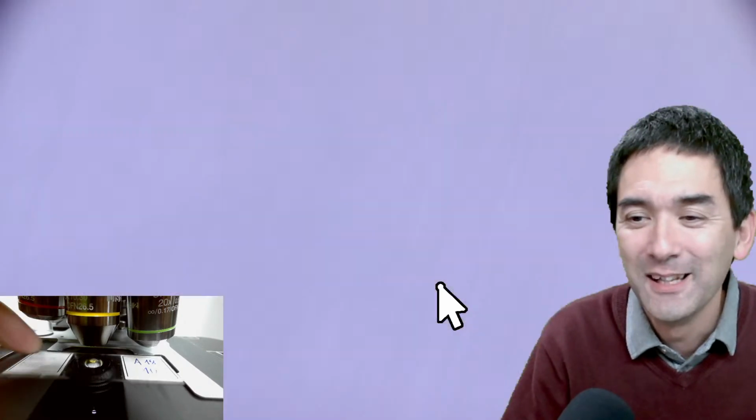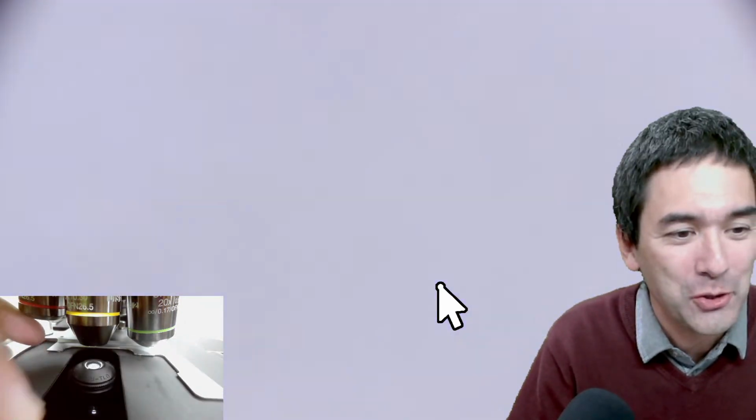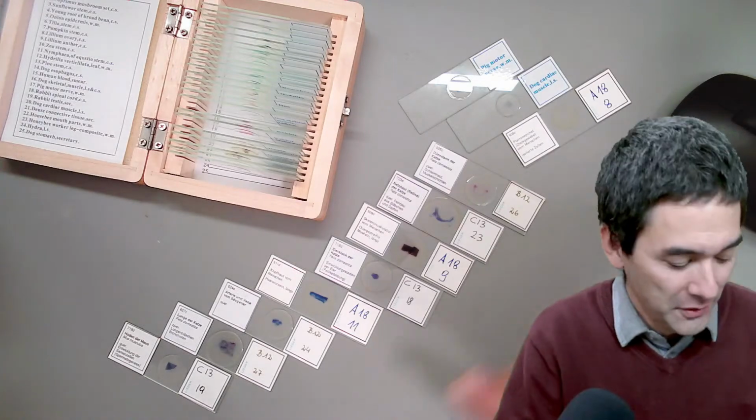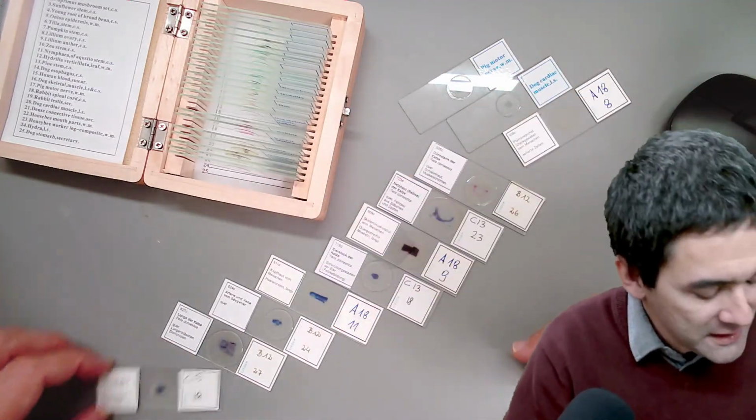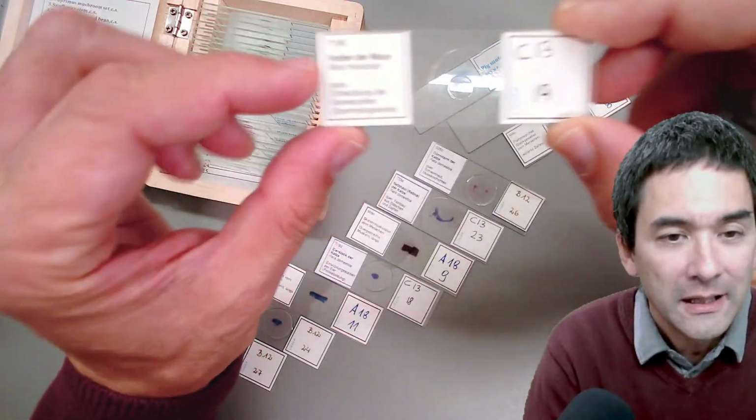Sometimes it's so much easier. So this is basically the first thing I wanted to show you. So it's a little bit arbitrary. Yeah, I can talk a little bit more about this here.